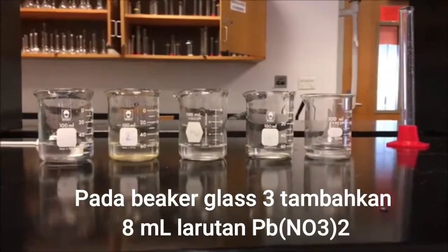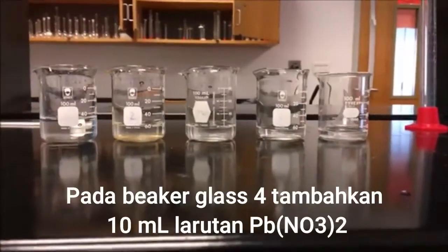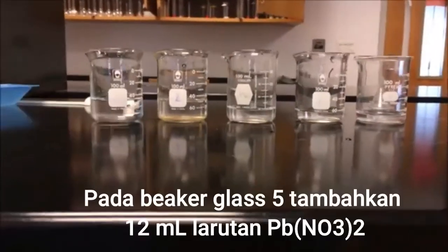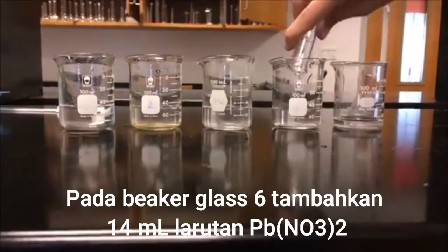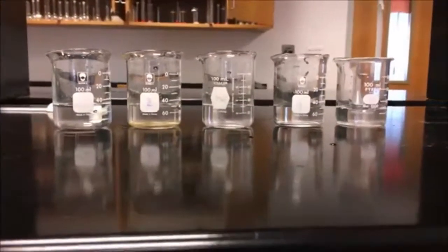For the third, add 8 milliliters. Add 10 milliliters for the fourth. 12 milliliters for the fifth, 14 milliliters for the sixth, and 16 milliliters for the last beaker.